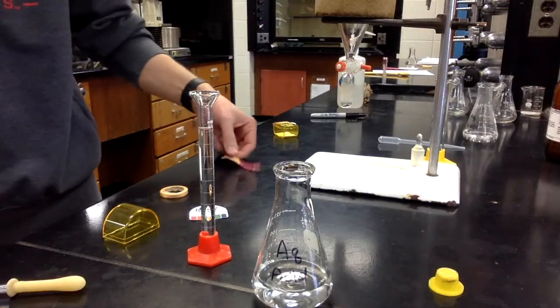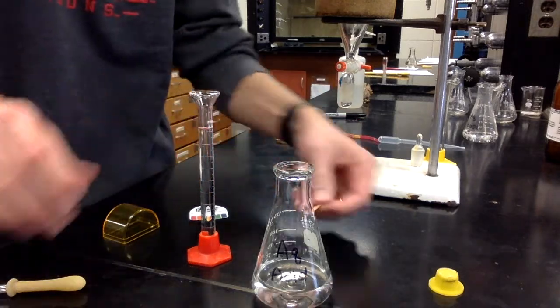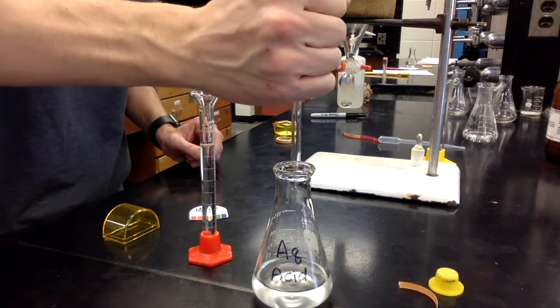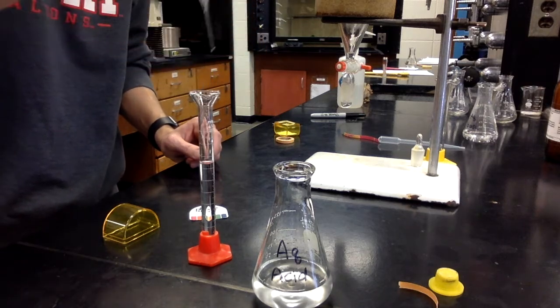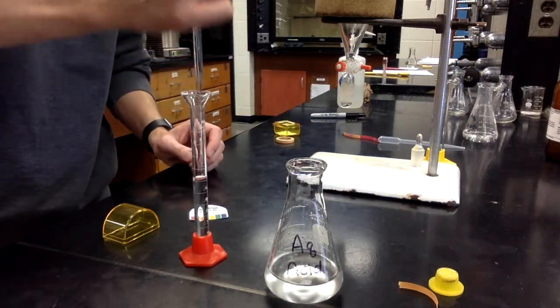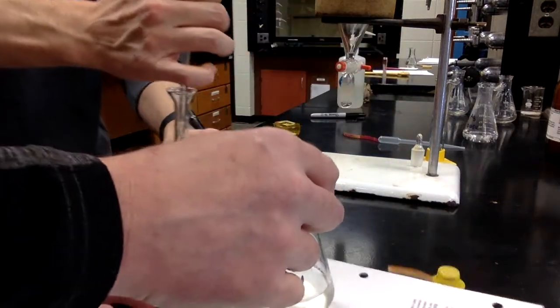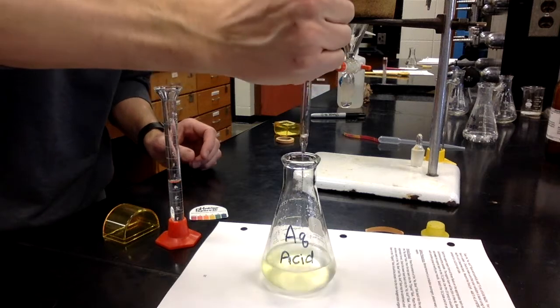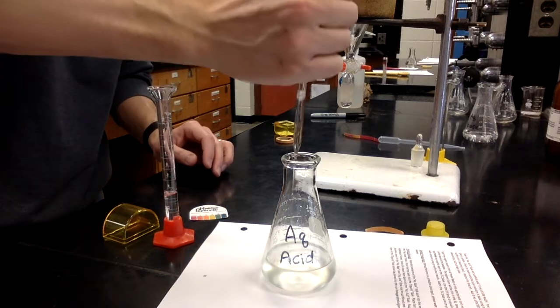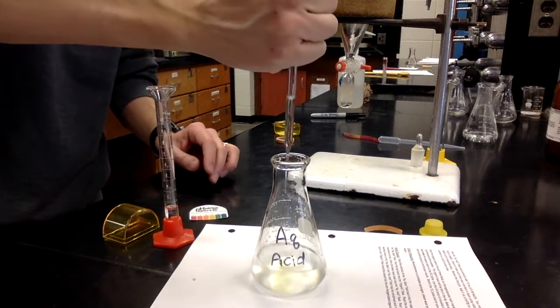This acid solution, we already checked its pH, and it was near 1, very acidic. So now we're going to add our base solution to that and see what happens. So we're adding our 6 molar sodium hydroxide. Well, if you can see, there's a little, hold on a second. Looks like it's turning a little yellow. Color change, yeah. So let's put a white bottom underneath that. And so when you see the base go in there, you can see a yellowish color. Yeah, it's really nice. Almost like that phenolphthalein indicator during a titration.